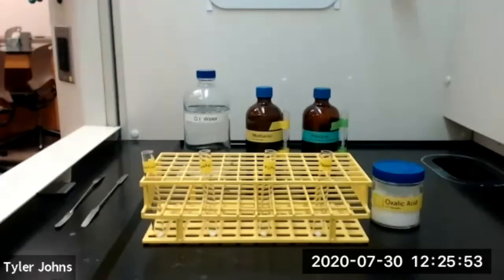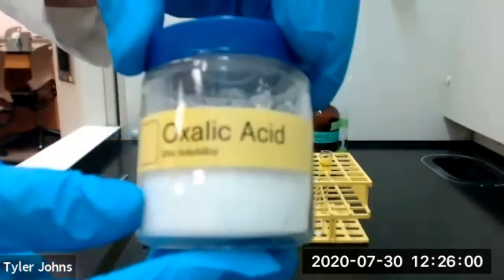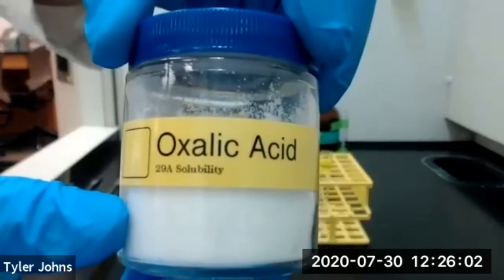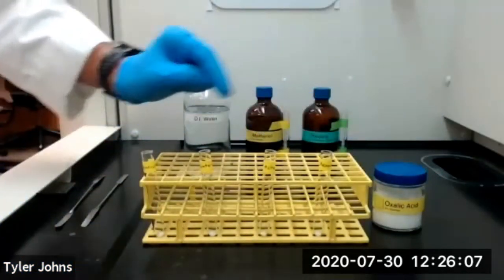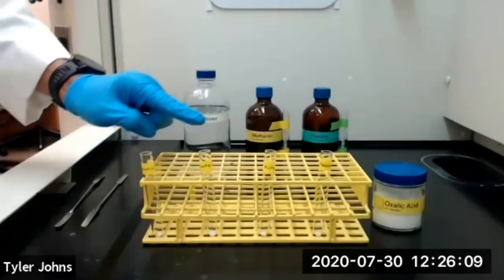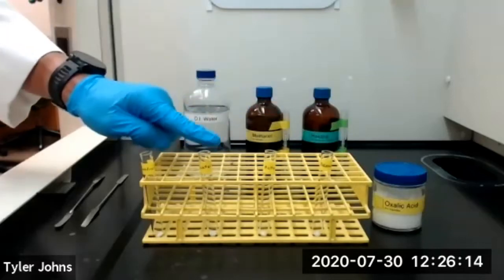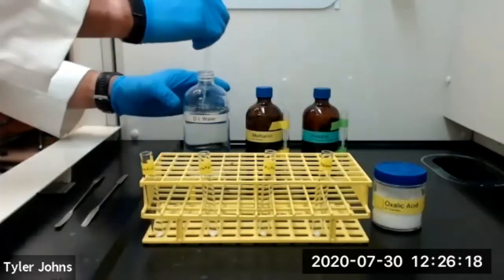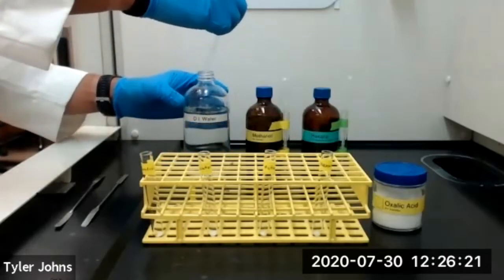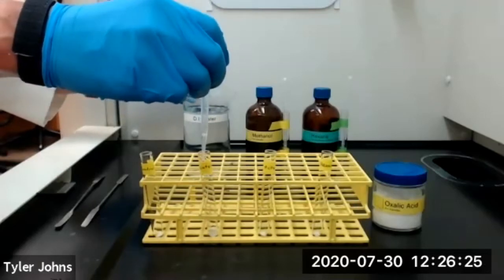We're next going to repeat this procedure and investigate the solubility of oxalic acid. So we have our oxalic acid here, and we've added 40 milligrams to 4 separate test tubes. We have a test tube for our control, for water, for methanol, and for hexane. So we'll start with our deionized water. And we'll add 1 milliliter of deionized water.